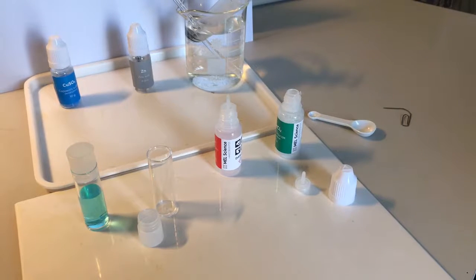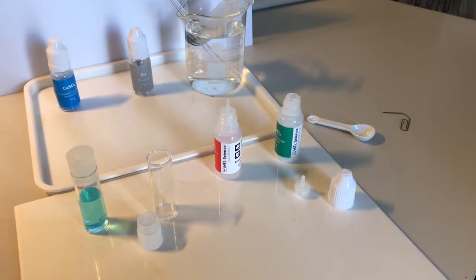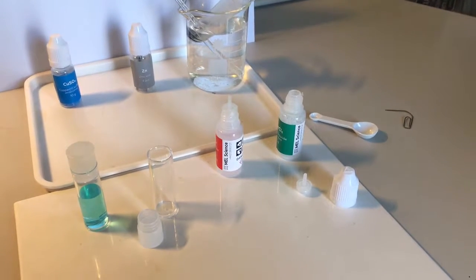Next, we prepare a tin chloride solution by mixing tin chloride with sodium bisulfate.